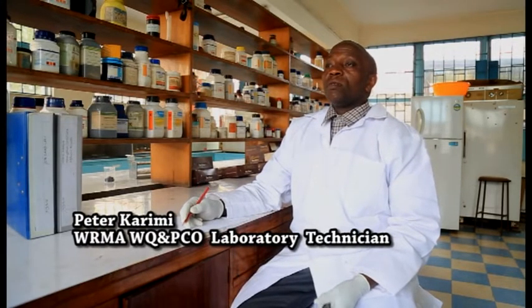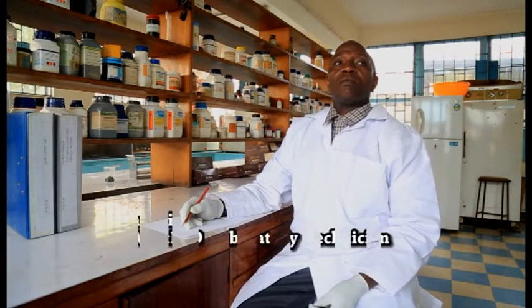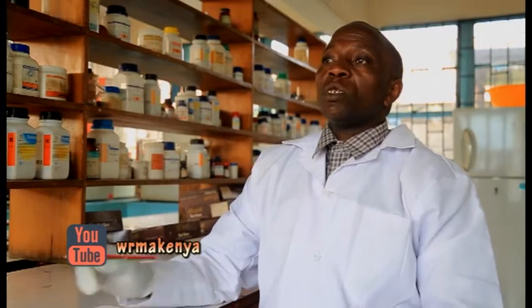I work in this wastewater section as a water quality and pollution control officer. Basically, here we do a number of parameters. The one that I have presented is total suspended solids. In wastewater, we have total dissolved solids, we have total suspended solids, and what I have demonstrated is total suspended solids.